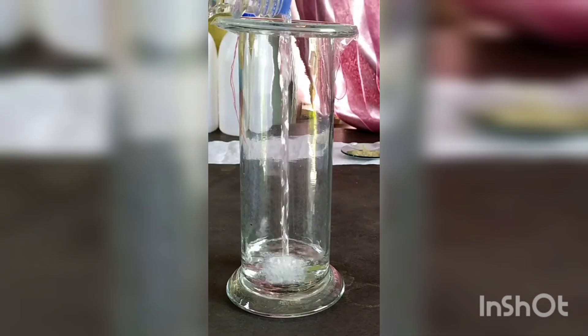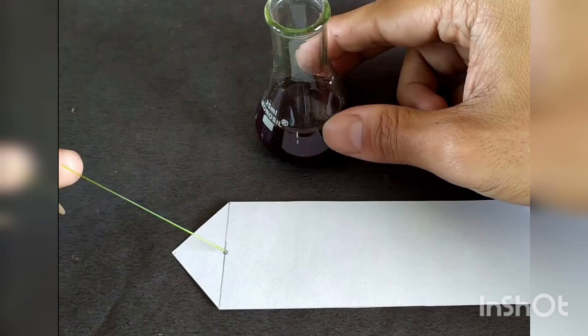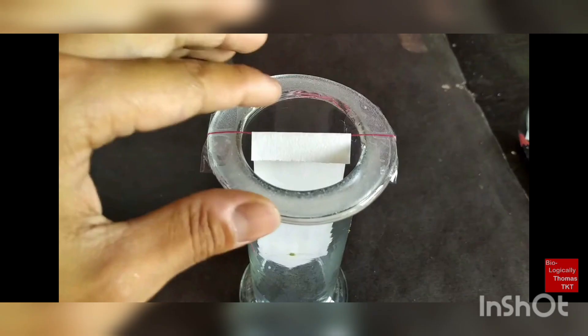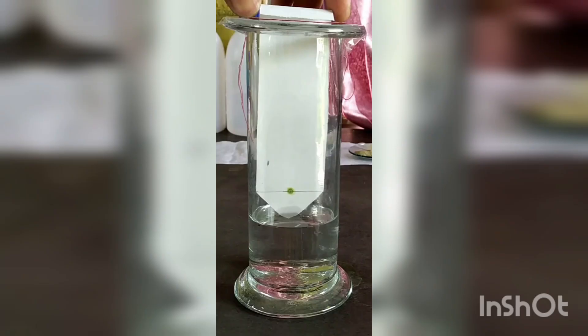First, you have to cut out the chromatography strip to a pointed end, then mark with a pencil in the center, and then upload the extract or mixture we have made. Like this, we will hang the strip, and after that we will get this type of result.